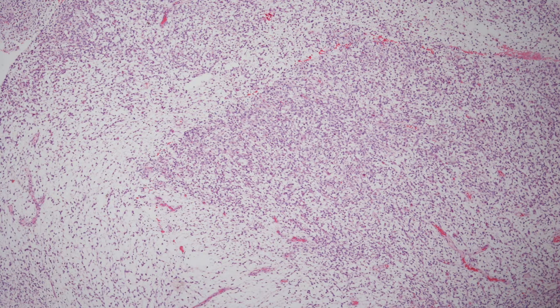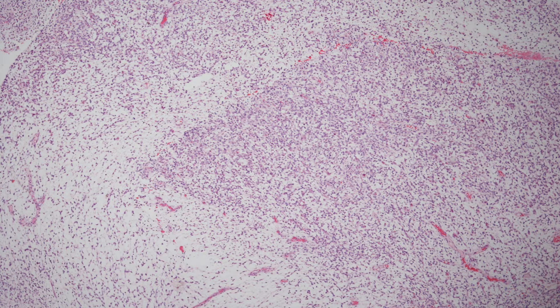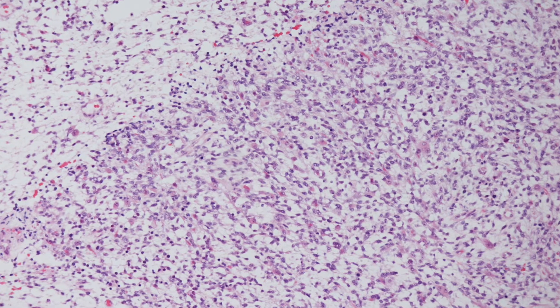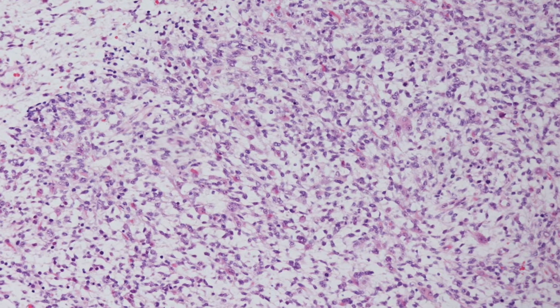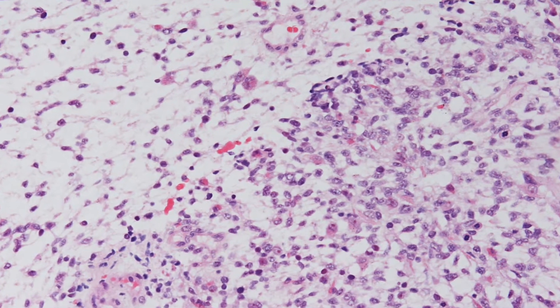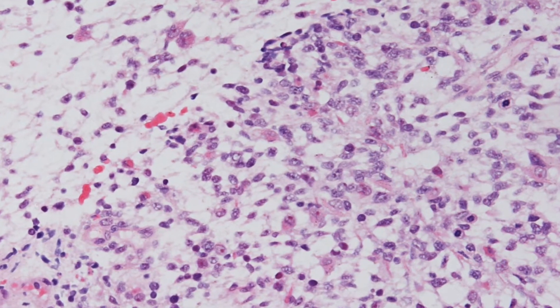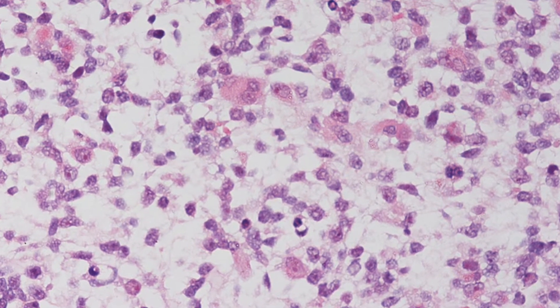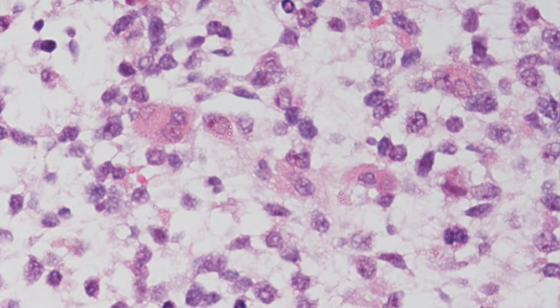Here is a low power view, a slightly higher magnification, another higher power field, and here's another picture. The cells we are zooming into have rather abundant pink cytoplasm, and they should give a clue as to the diagnosis.